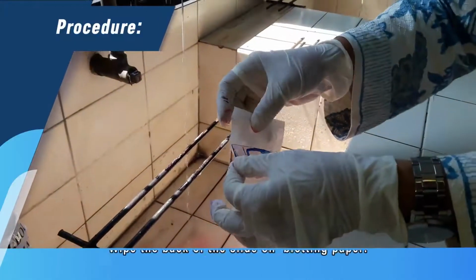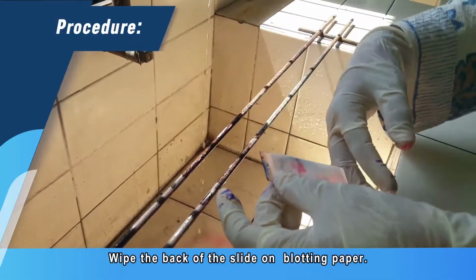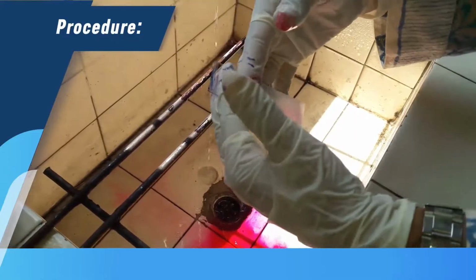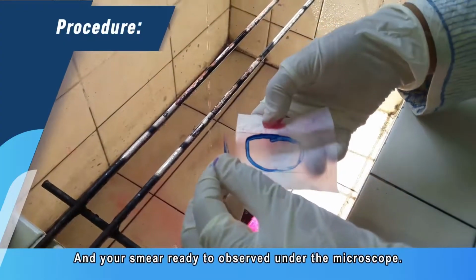Then you can wipe the back of the slide on blotting paper. After the slide is completely air-dried, the smear will look like a thin colored haze, and your smear is ready to observe under the microscope.